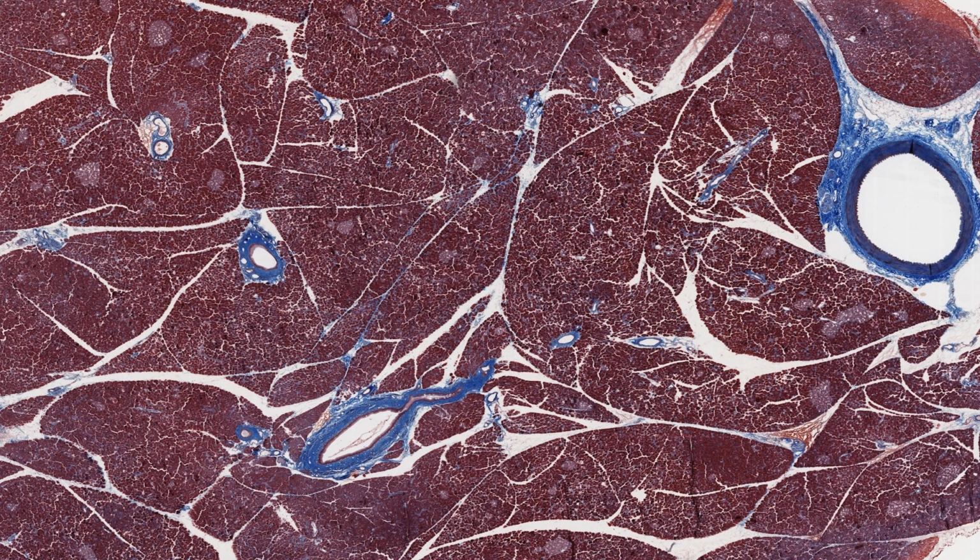The pancreas is one of a group of glands large enough to need septa or cords of connective tissue, breaking the gland up into lobules. This section of the pancreas has been stained with a Masson trichrome stain, which emphasizes the stroma, which stains bright blue. And within these stromal elements, ducts and blood vessels can be seen.